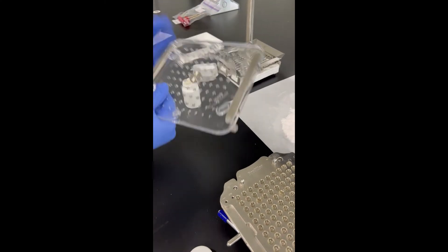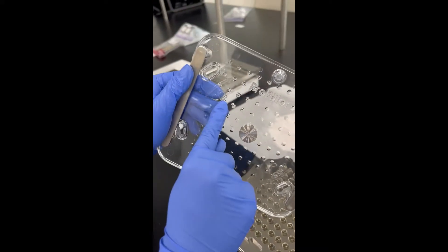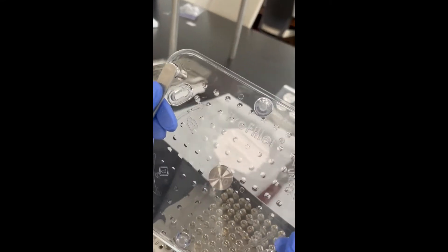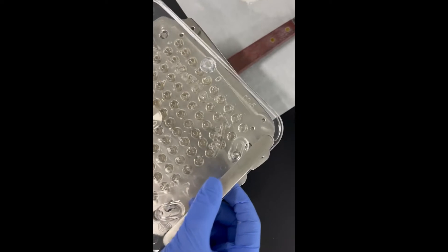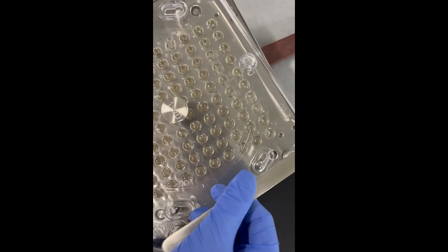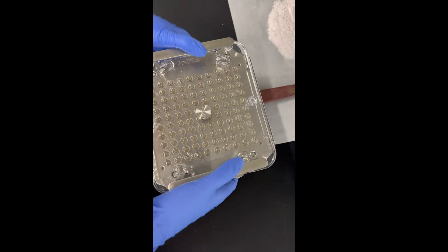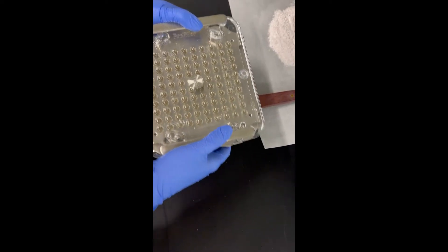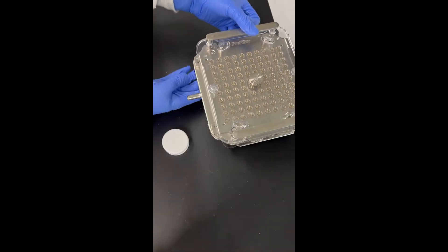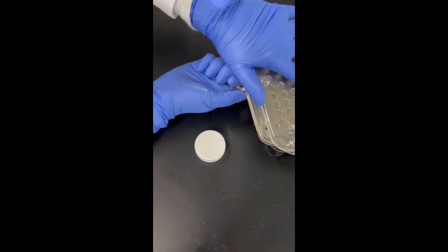Take this clear piece and there's a little lock on it that we'll use in a moment. When you put it on, you're going to put it in the bigger holes, so you'll have to do it sideways. Once you get them all in the holes, you're just going to lock it. Then this little lever — you're just going to pull it out to tighten and keep hold of the bottom part of the capsules.